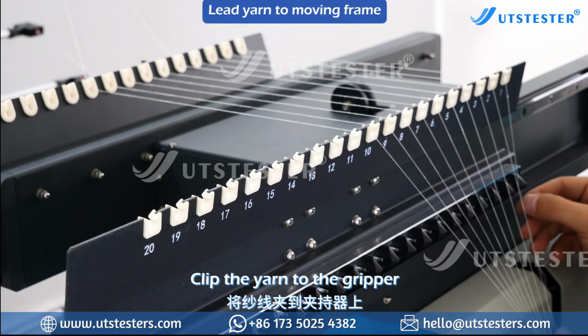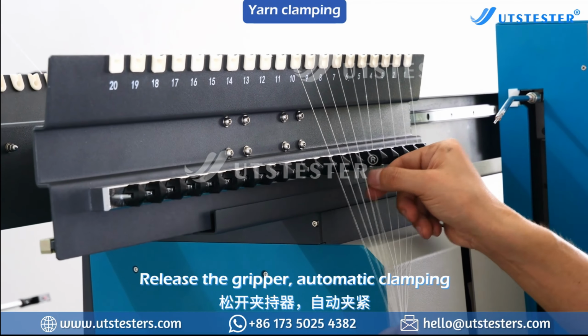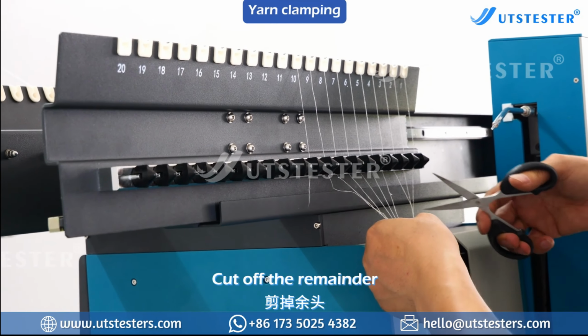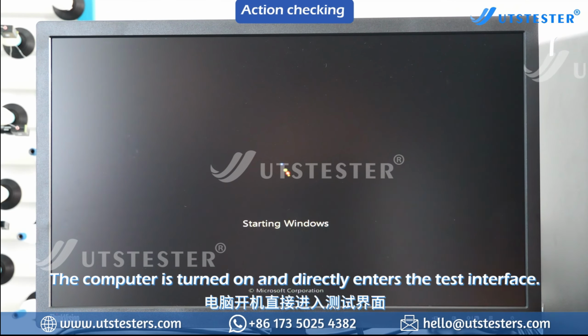Clip the yarn to the gripper. The holder is pulled out to place the yarn. Release the gripper, automatic clamping. Cut off the remainder. Yarn sample installation completed. The computer is turned on and directly enters the test interface.